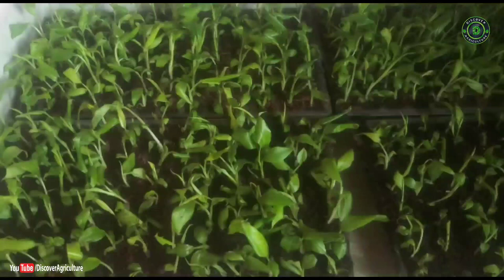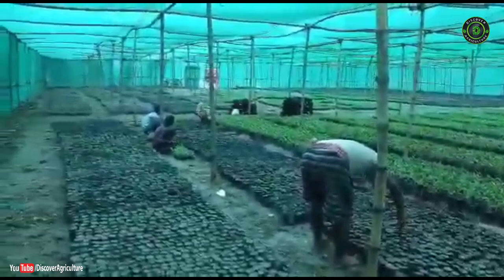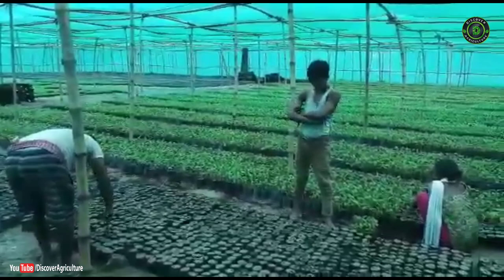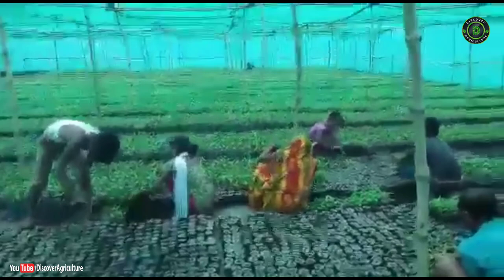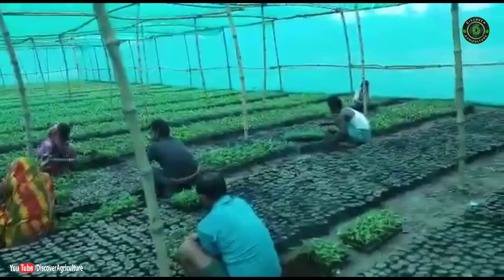8 cm shoots with 3–4 ramified roots are planted in individual micropots in a pot tray. Where weather is conducive — 24–26°C temperature and more than 80% humidity — the plantlets are hardened for 4–6 weeks in mini sand beds. During this period, 90–95% humidity is maintained for the initial 6–8 days under diffused light.